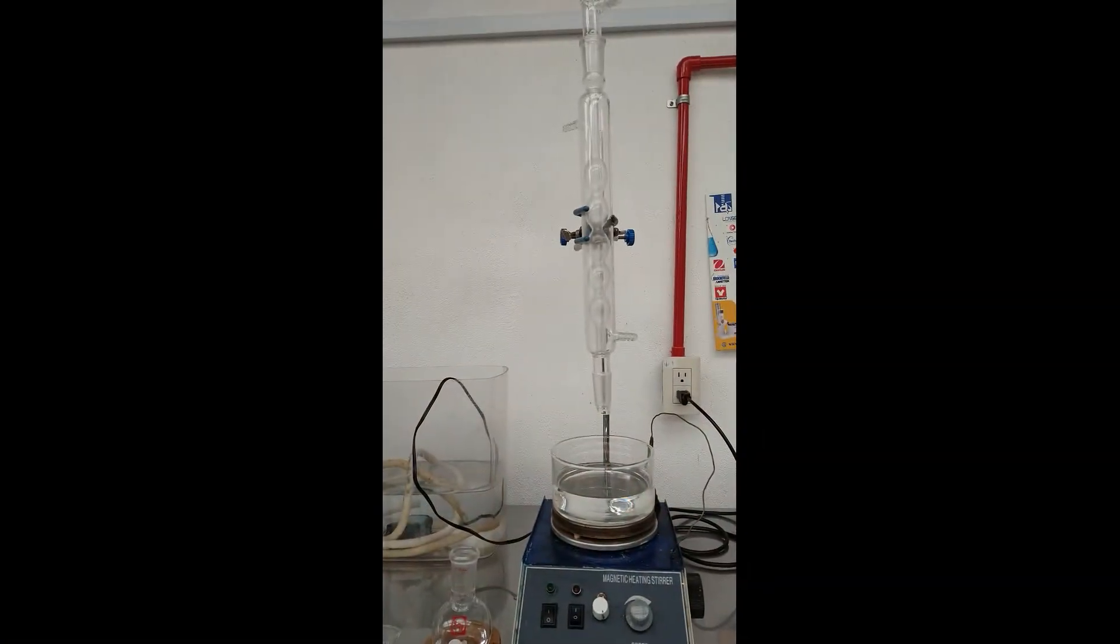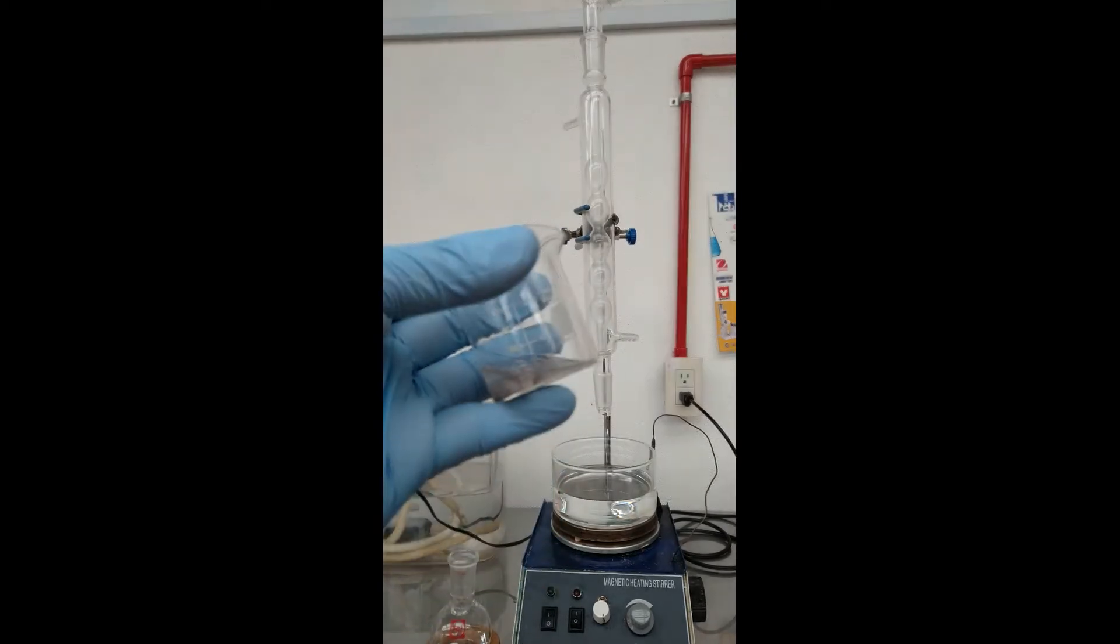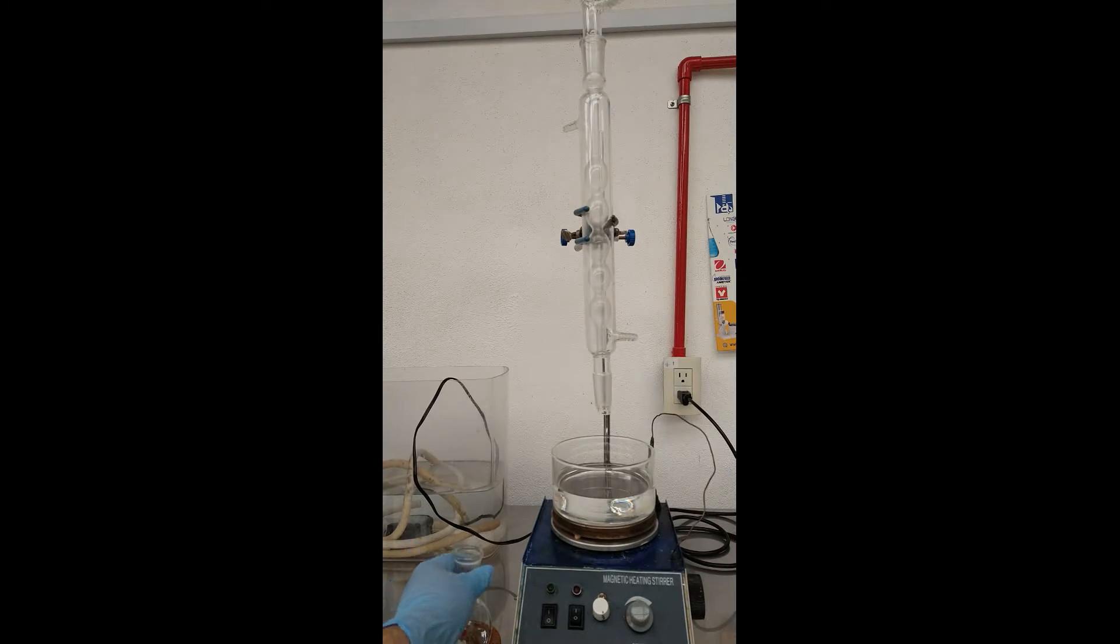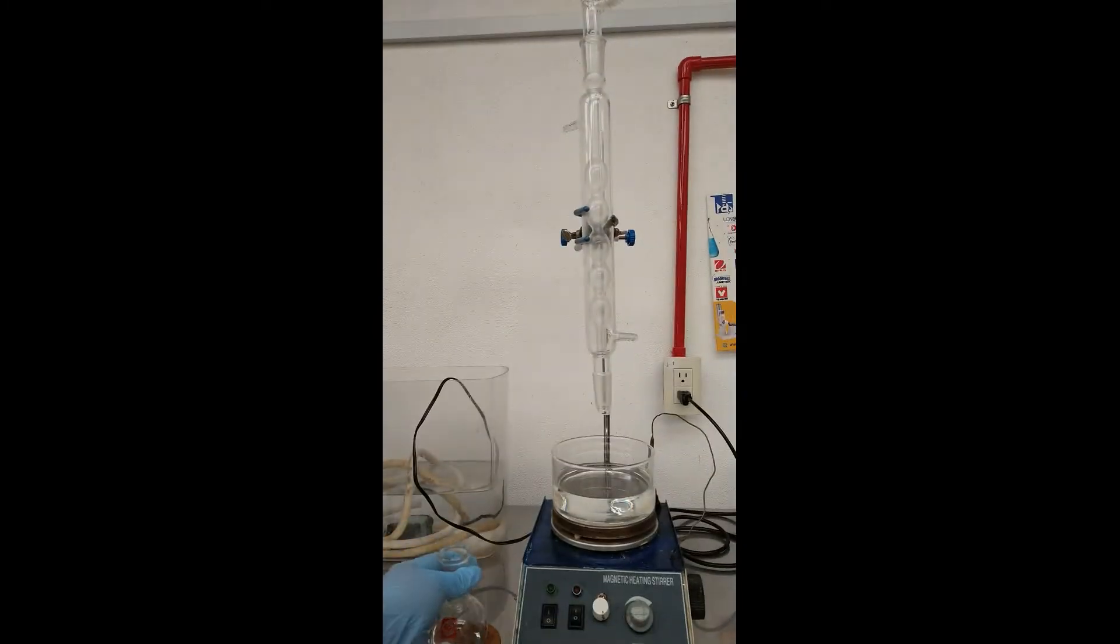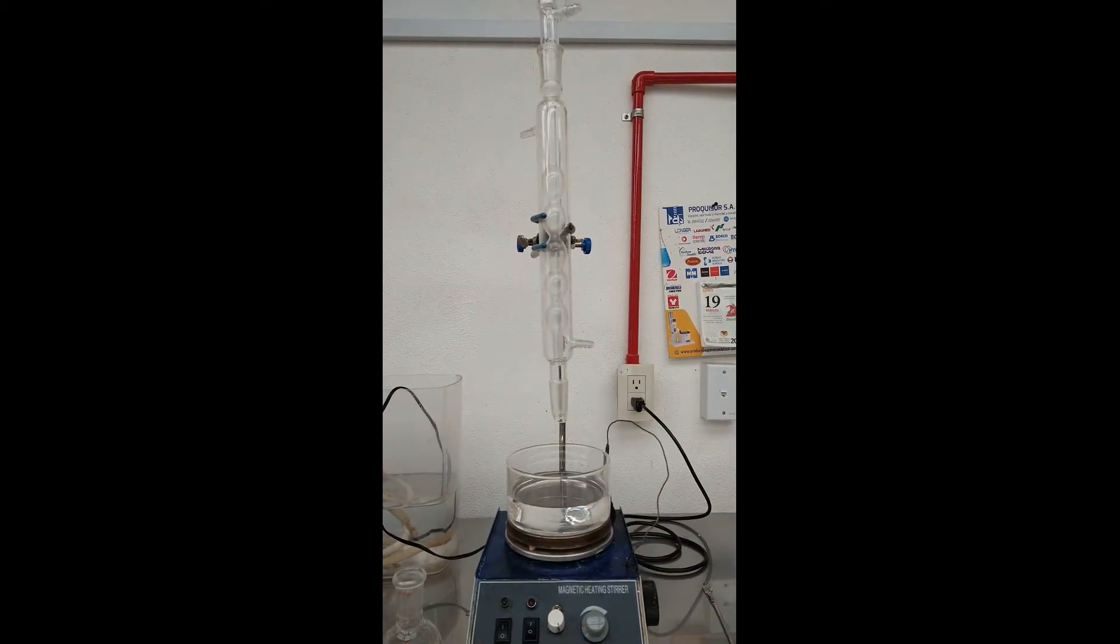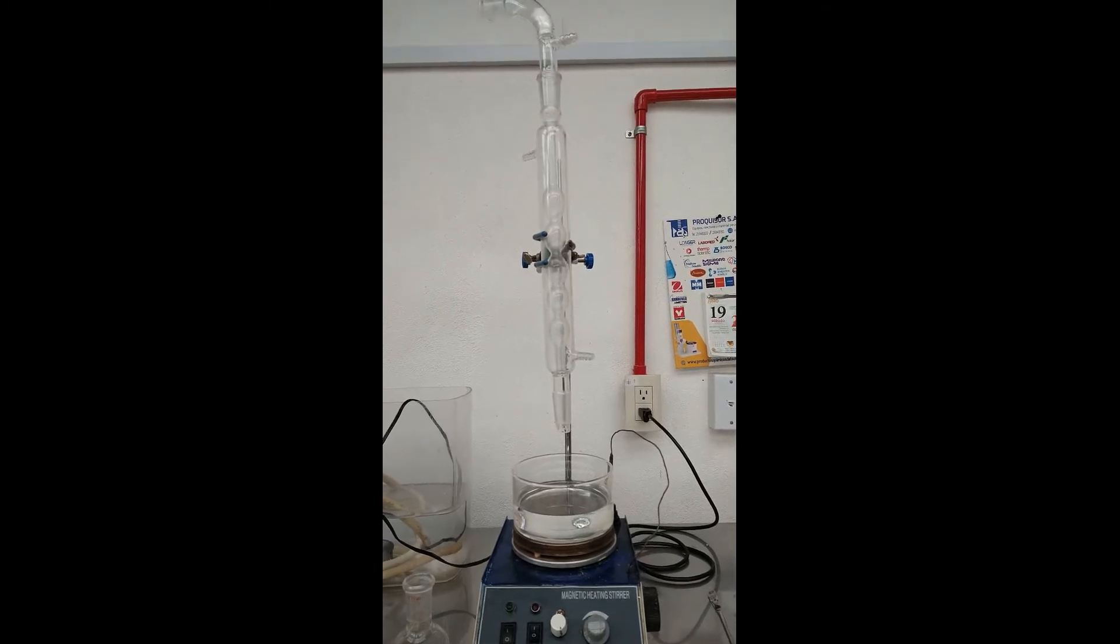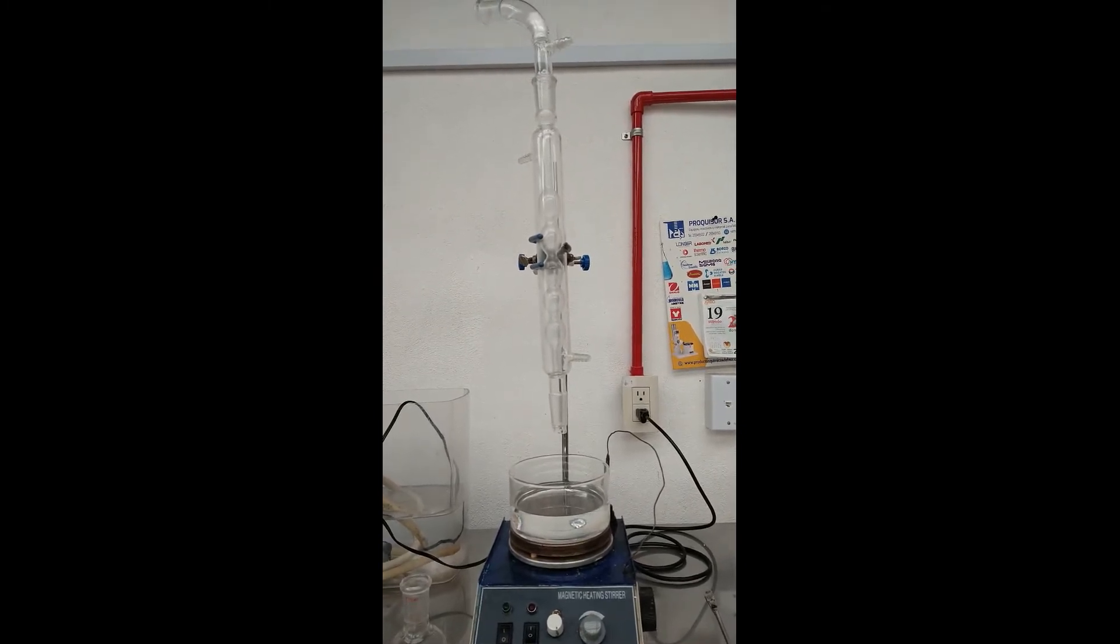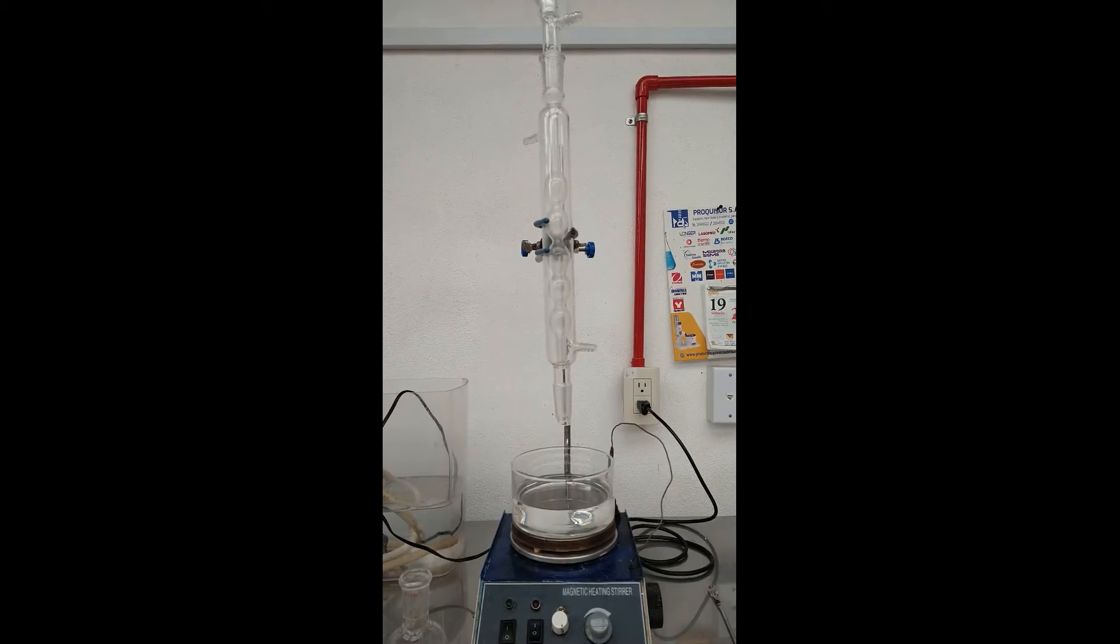We have here our device already mounted with our reagents: the sodium metal beads, the ethyl acetate, and finally our condenser with a humidity trap at the top made out of calcium chloride anhydrous.